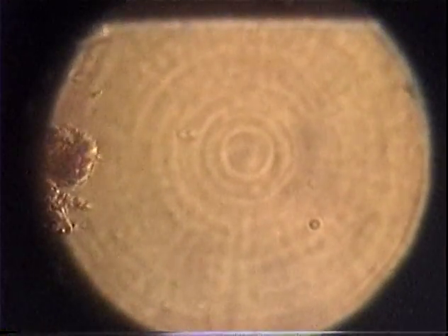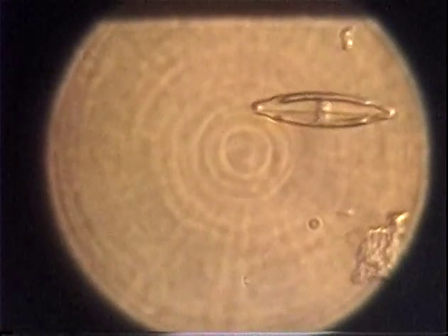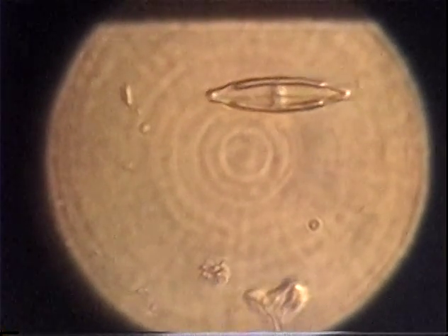I'm gonna go up to higher power here. Oh, and it went into something really big, and there it is, right there. You see? Look for something. It went into that. Oh, look over there. Look at that. Hey, it's running away. All right, you guys imaging this? Are you getting a picture of this? I think I've already found it. I already have a picture of it. I didn't give you your ID sheet yet. How could you have found it? I think we've already seen a specimen of it. Let me see it.